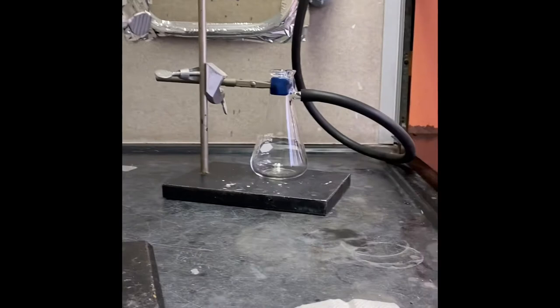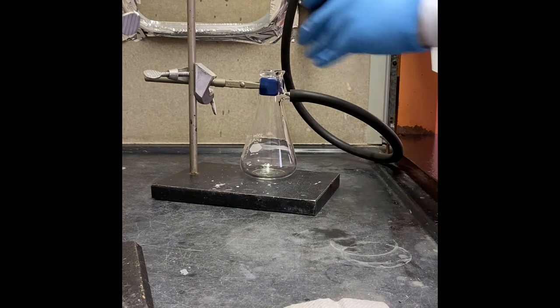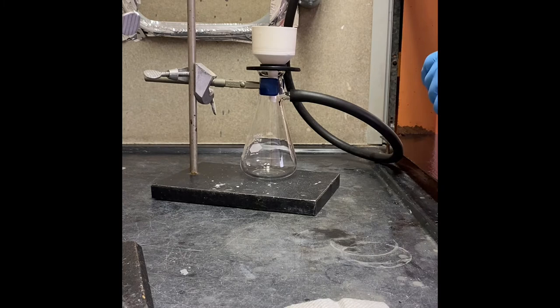Setting up the vacuum filtration: vacuum tubing, filter paper, right size adapter, and that's around the back.